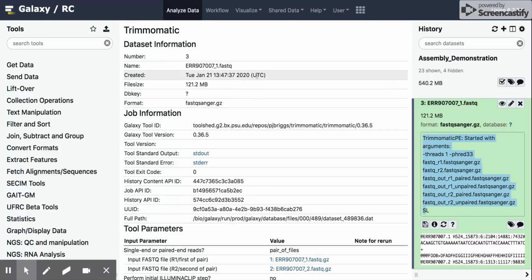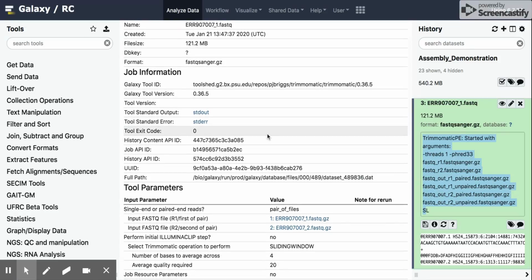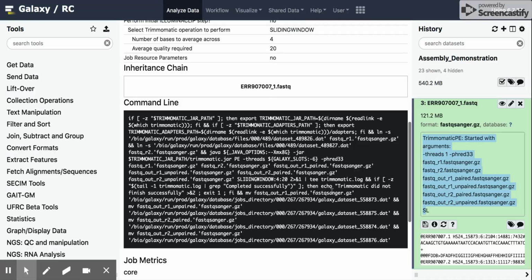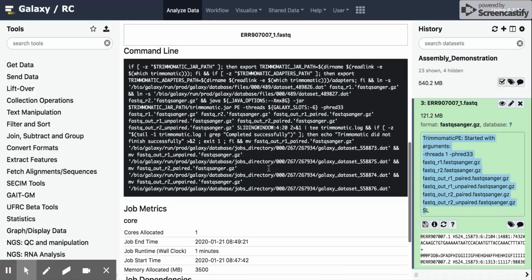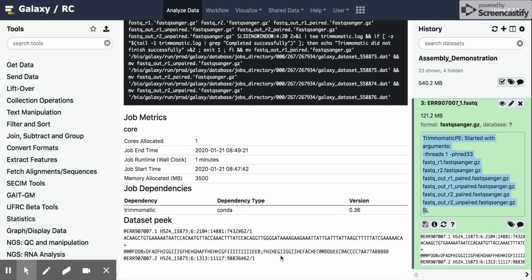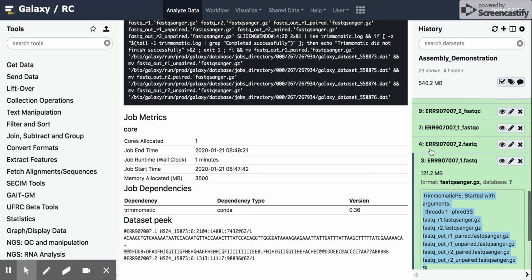If we look at the information here, we can see the input file, the size of it, the tool that was run on it, Trimmomatic, the inputs for this, which were the forward and reverse read, the commands that were used on the command line to run Trimmomatic, and how long the job took. And again, a little bit of the information on what the file looks like.